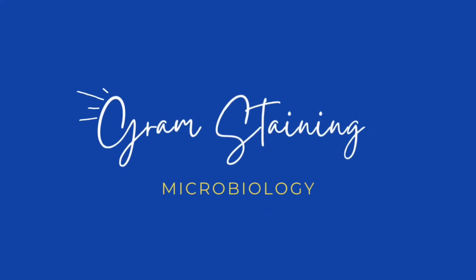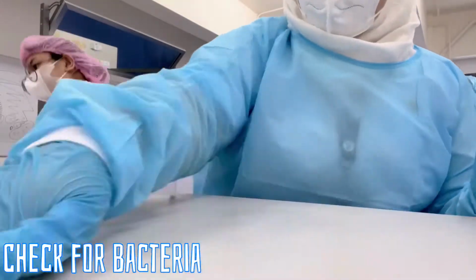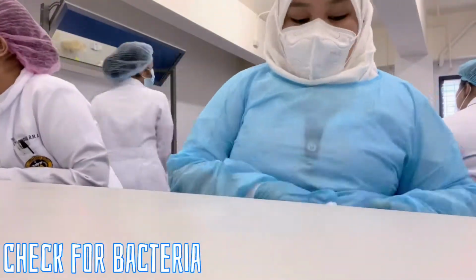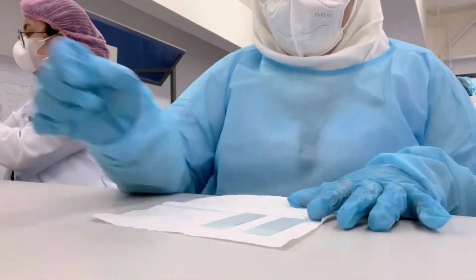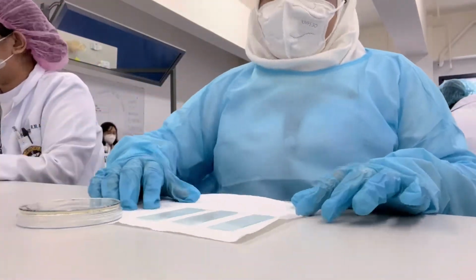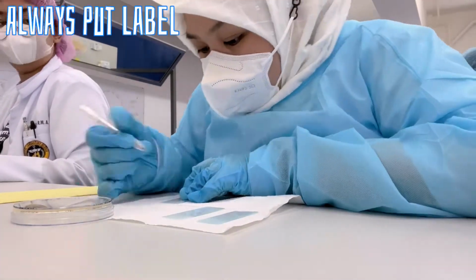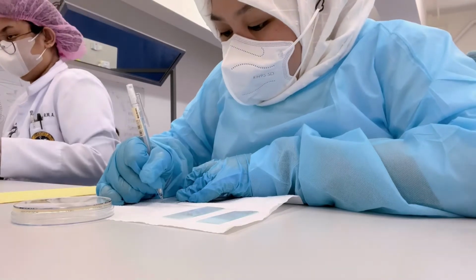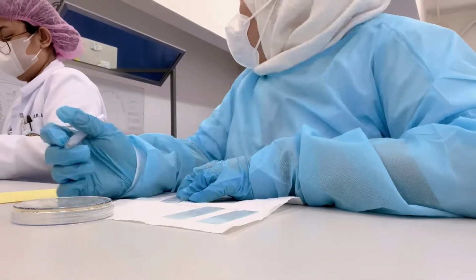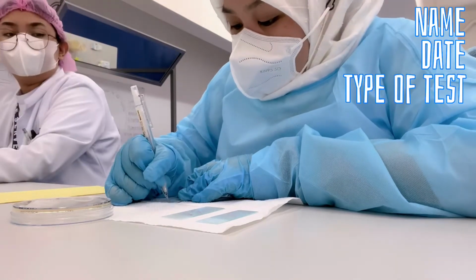Second is gram staining. It is done in the microbiology section to check for bacteria at the site of suspected infection. To start, disinfection should be done to avoid contamination. Also, labeling should be done before conducting the test. It should include the patient's name, date, and type of test.